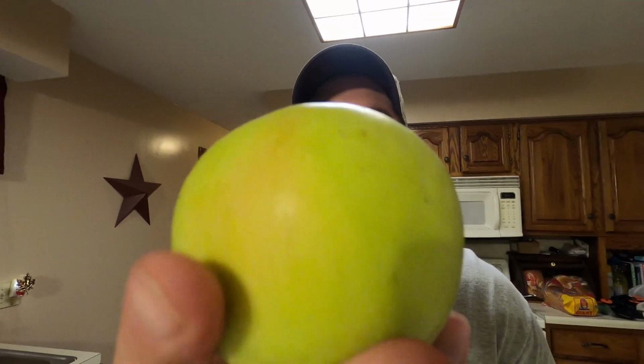We're going to be manipulating some enzymes. How, you may ask? Well, right here in this apple. Have you ever bitten into an apple and let it sit for a few minutes, and next thing you know, you come back to it and it's brown and mushy? What caused that brown and mushiness in this apple? To be very surprised, it's actually an enzyme inside this apple. Right now, this apple is protected by the outer skin. No air can get into this apple right now.